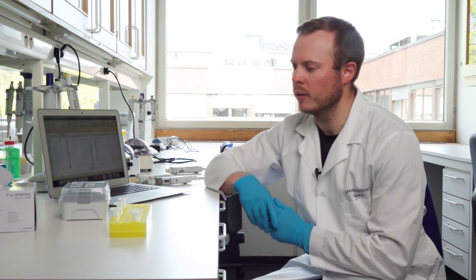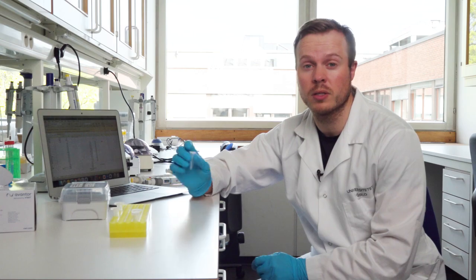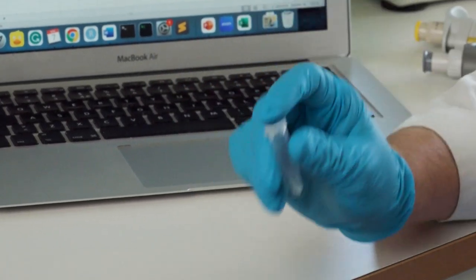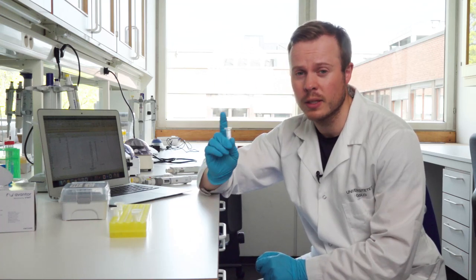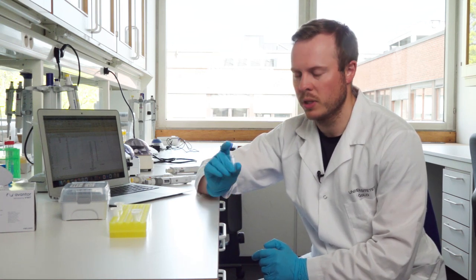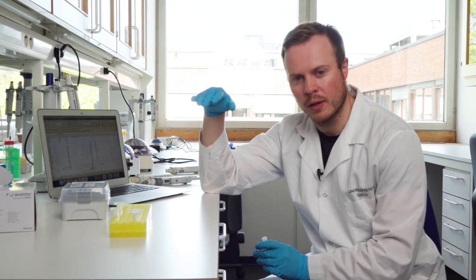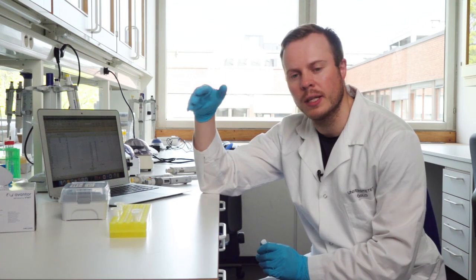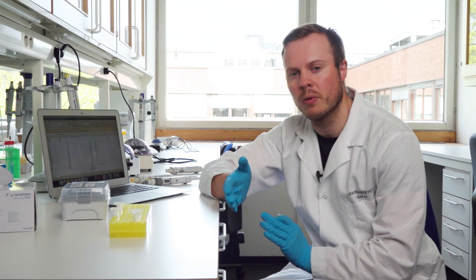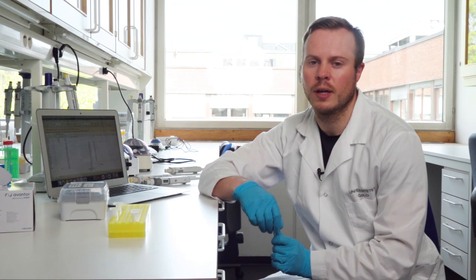Yes, and then we have made our pool. And then it's just the last bits of quantification that we need to do with the pool. And this is something that is required by the sequencing firm. We are required to take one last gel of only the pool and a ladder. This is for the sequencing firm to see if we have dimers as well, that the pool looks nice. So we need to make a final gel and you also need to do a nanodrop. And the nanodrop is to show the quality of DNA: how much proteins, how much salt, how much DNA is in solution. And here you use different absorption ratios. And the nanodrop is in the second floor, but you can ask us if you need to find it. And then it's just to fill out the required forms for the sequencing and send them in. And then you're done.